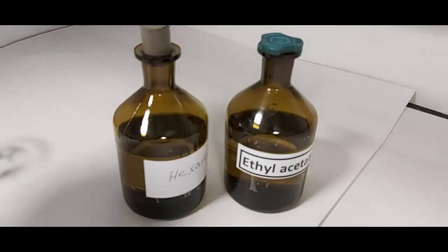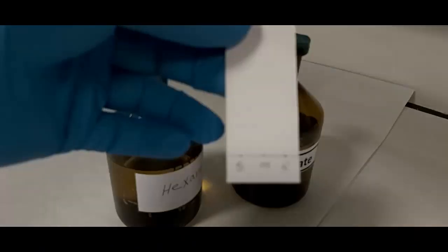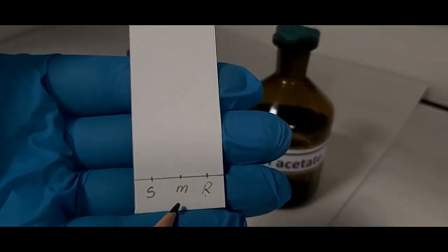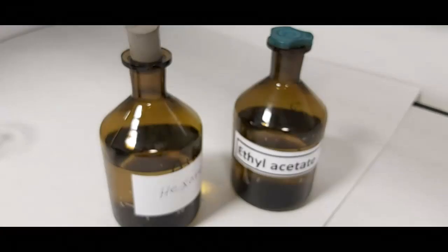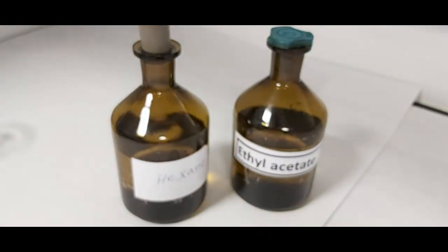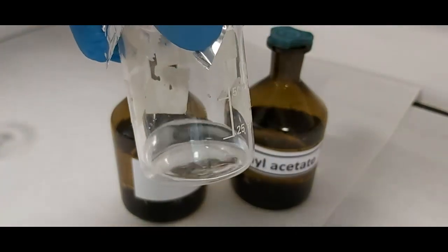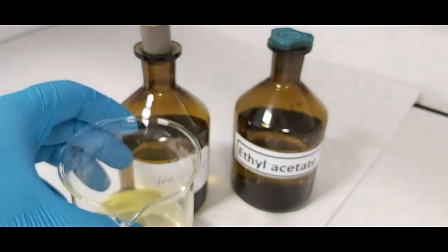To develop the TLC I need a solvent mixture of ethyl acetate and hexane. I have a TLC plate prepared. I prepared 10 ml of the solvent system: hexane to ethyl acetate one-to-one, meaning 5 ml of hexane and 5 ml of ethyl acetate, using a graduated cylinder.